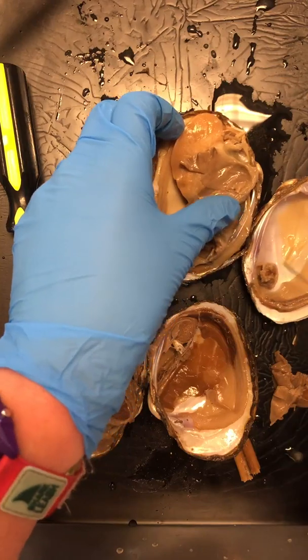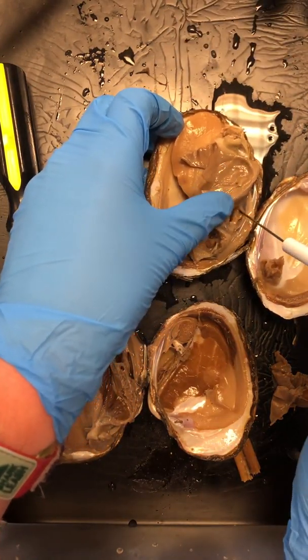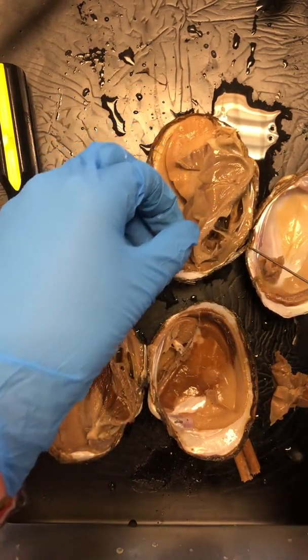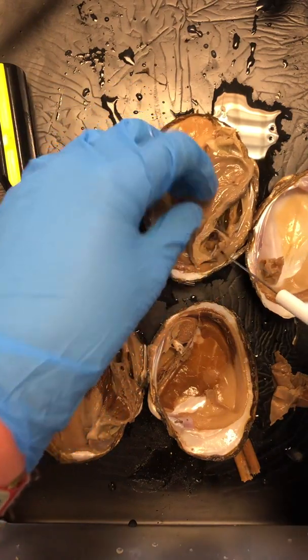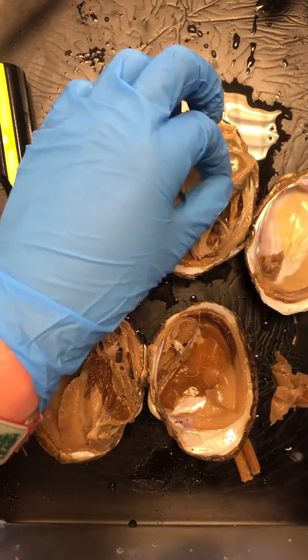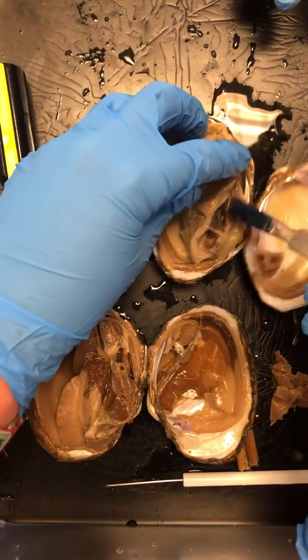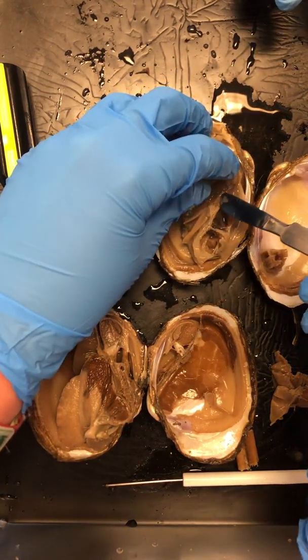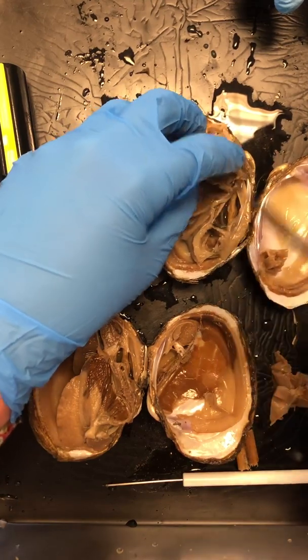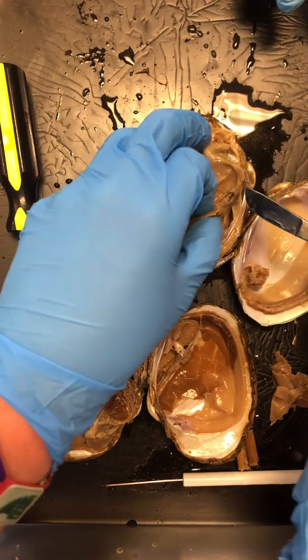You want to see what it was eating last? Yes. What do mussels eat? They are filter feeders, so they're going to eat small microscopic particles that exist in the water. So like small pieces. I'm actually going to remove some of these gills because right now they're just in our way. Not popcorn. A lot of plankton. A lot of like marine worms. Some microscopic particles for the most part.